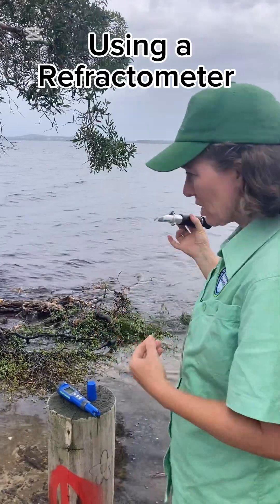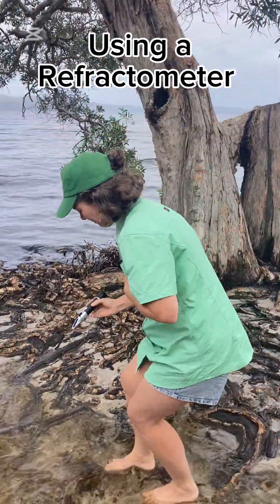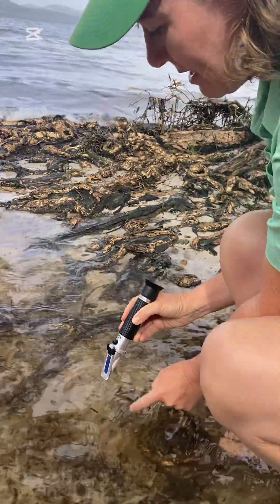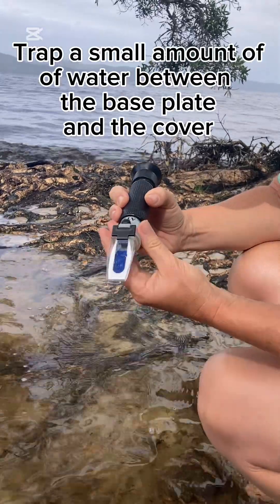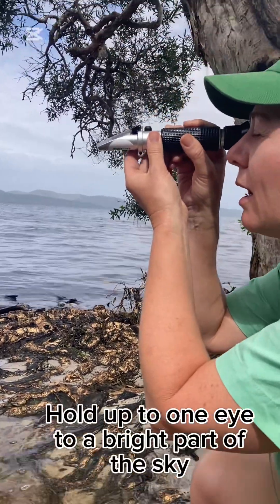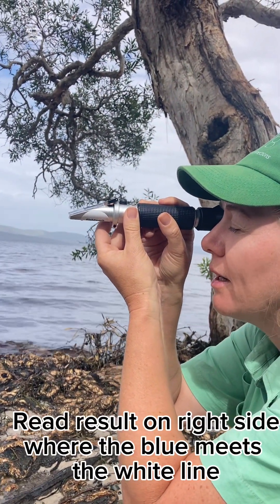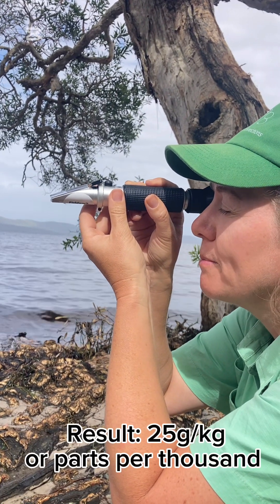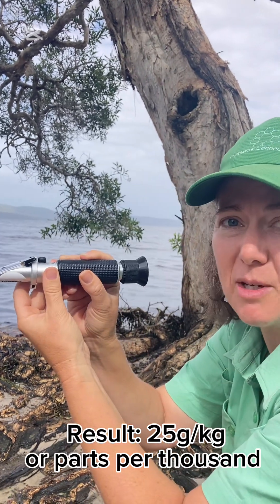You can see the water is just coming in here. I'm going to carefully put the end in, allowing there to be a nice film of water across the plate, put the cover on, and then hold it up to my eye to a bright area of the sky and take the reading. What I am seeing is 25 grams of salt per kilogram — that is parts per thousand.